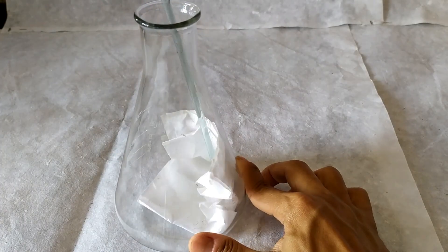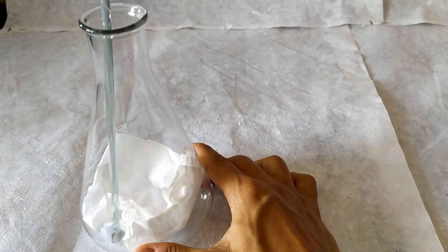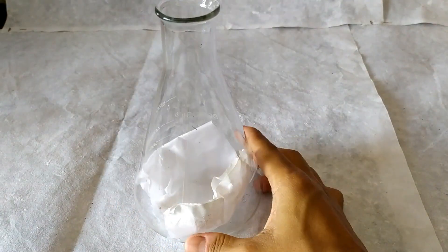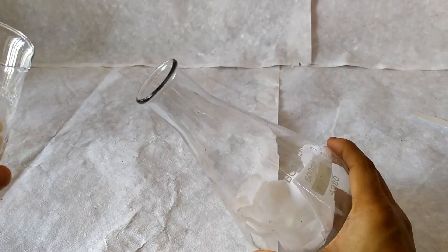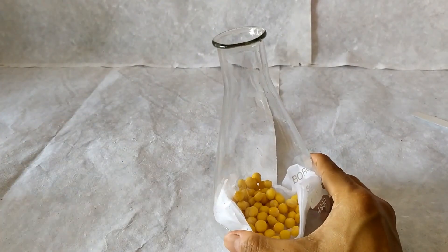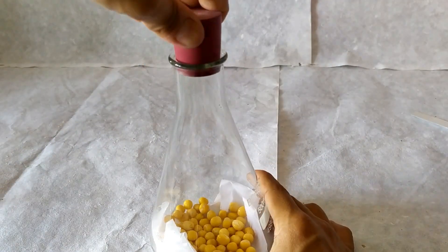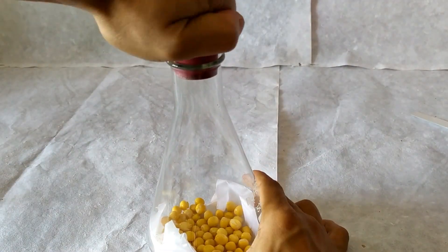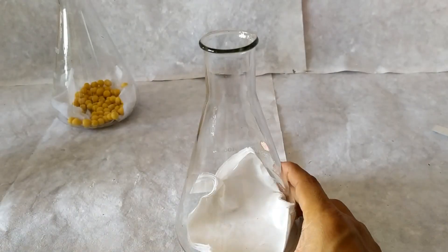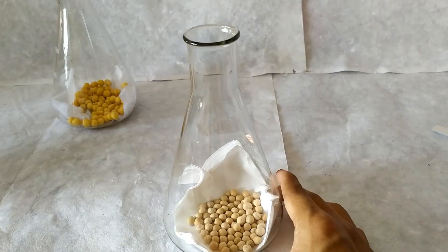Begin the experiment by inserting a layer of filter paper in the bottom of the two flasks. Wet the filter paper in one flask and introduce some pre-soaked seeds. Leave the filter paper in the second flask dry and introduce an equal amount of dry seeds.